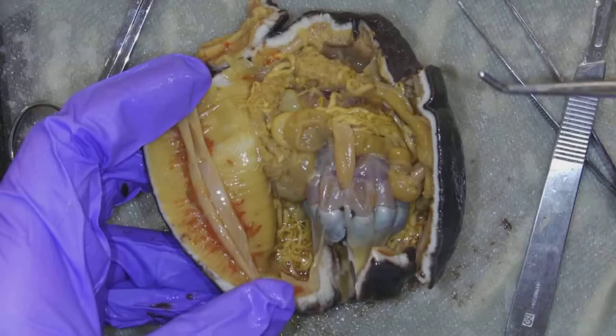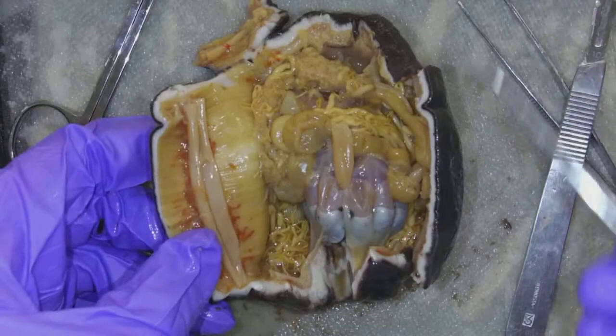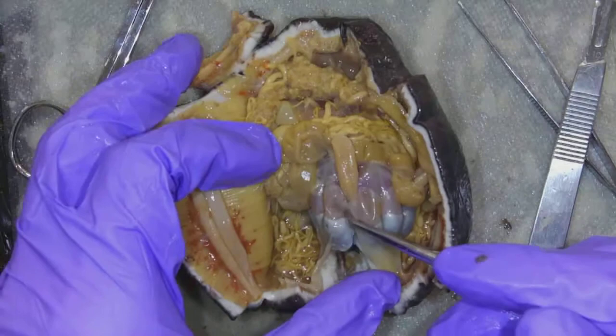When we were looking at it externally, we really couldn't tell heads from tails — we couldn't see the oral and aboral sides, we didn't know where the mouth was because everything was contracted and sucked in. He probably wasn't very happy in his last moments because he pulled in the tentacles.